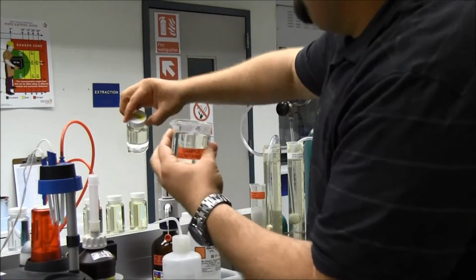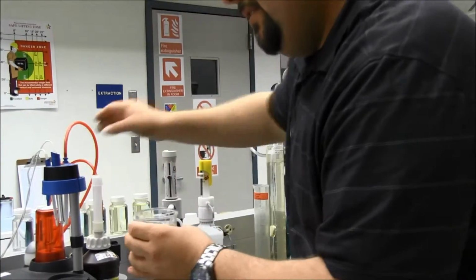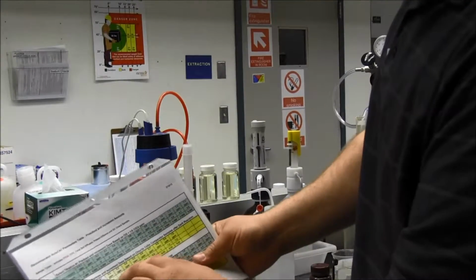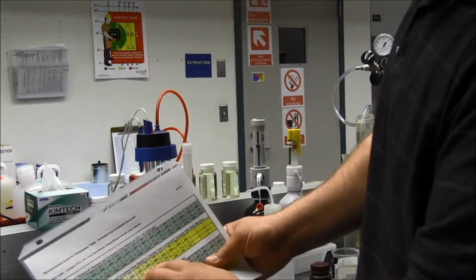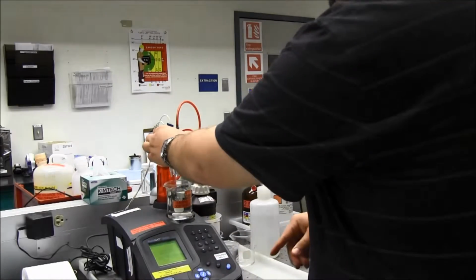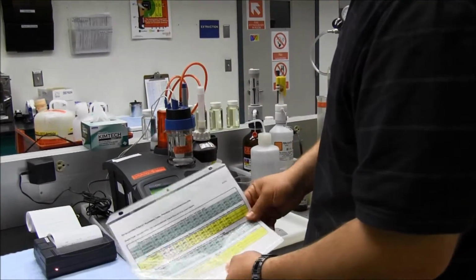So I'm going to take this, and what this says is it thinks that there's 0.4 milligrams per liter. So I'm going to throw this on here. I'm going to go to my chart, and I'm going to see 0.4, and it should tell me to pre-dose 0.3 milliliters, an increment of 0.02. So what I'm going to do, I'm going to hit the electrode in the sample, hit OK.